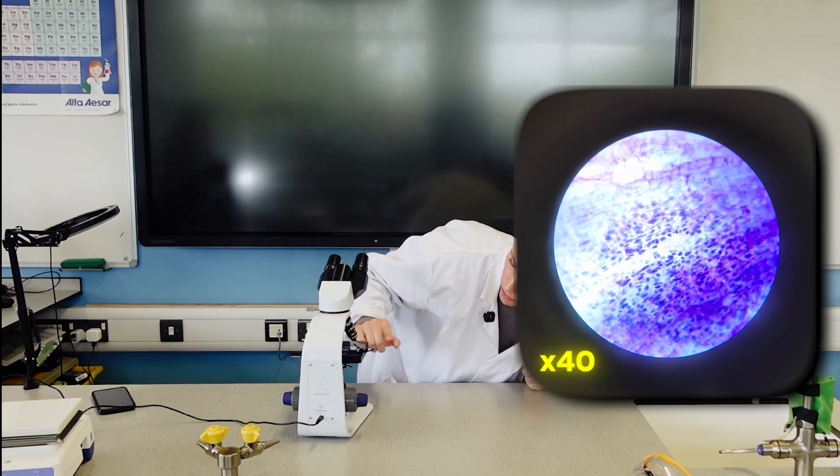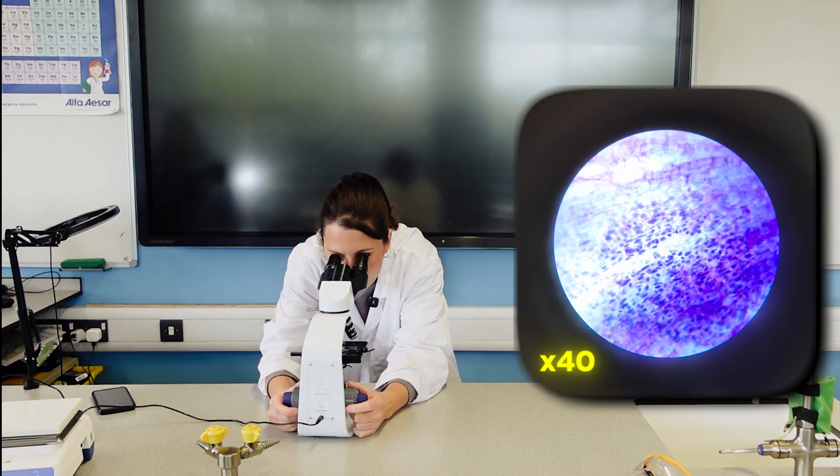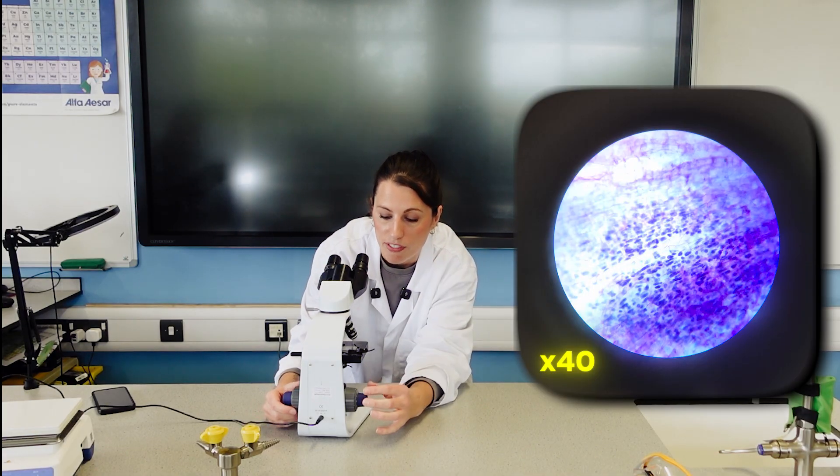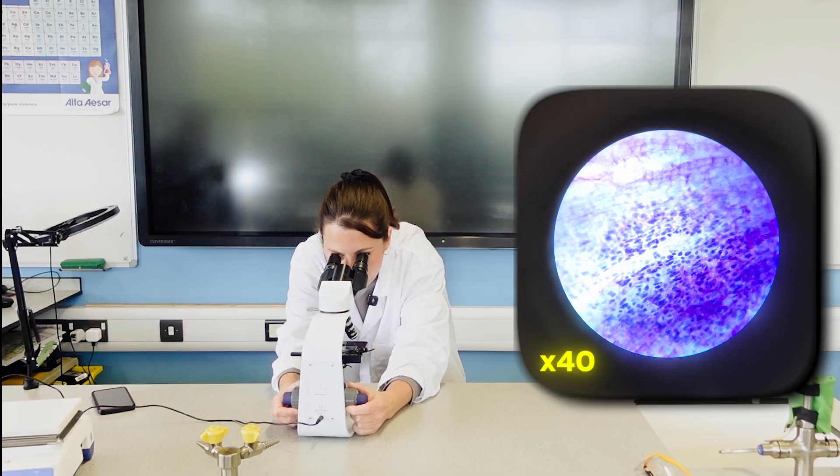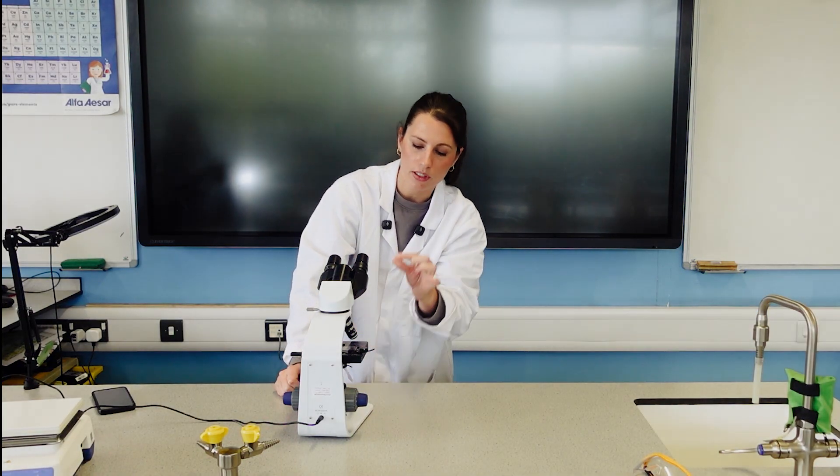That's why I was actually just checking from the side, making sure there was space. So then I'm going to have another look, and I was using these dials here, which are like our coarse and fine focus to get the image into focus. If students are struggling to get it to focus, generally speaking it pops into focus when the lens is very, very close to the slide.